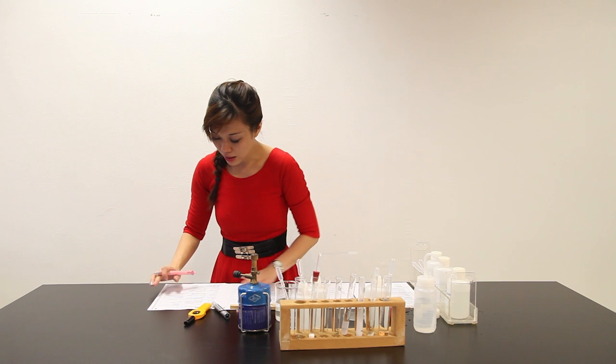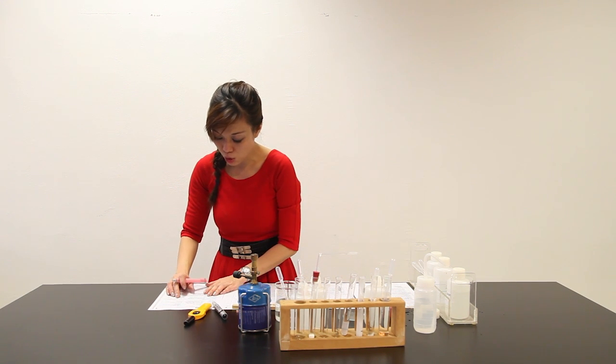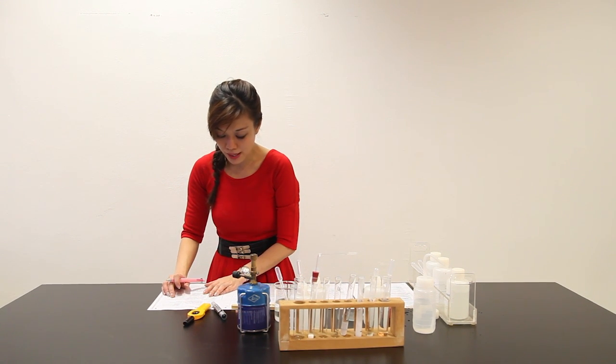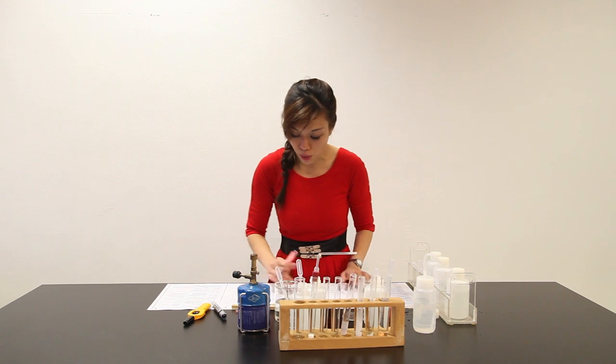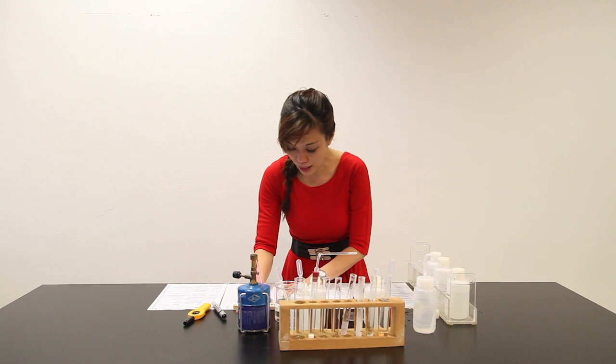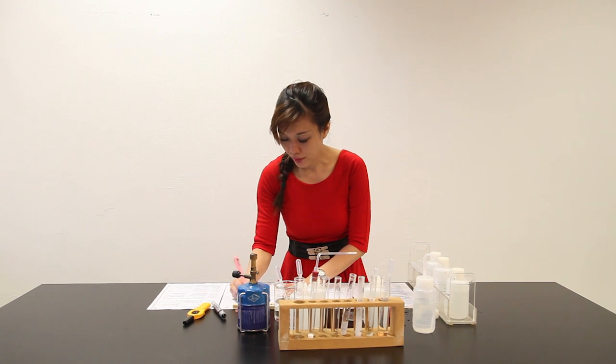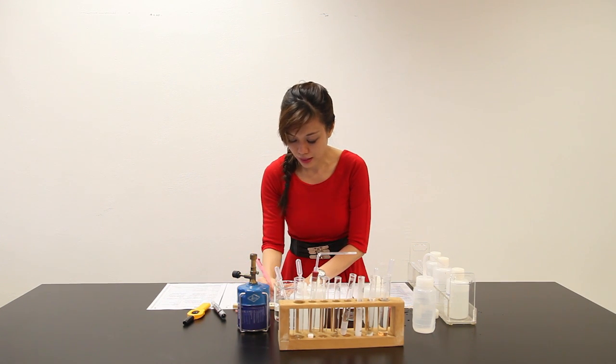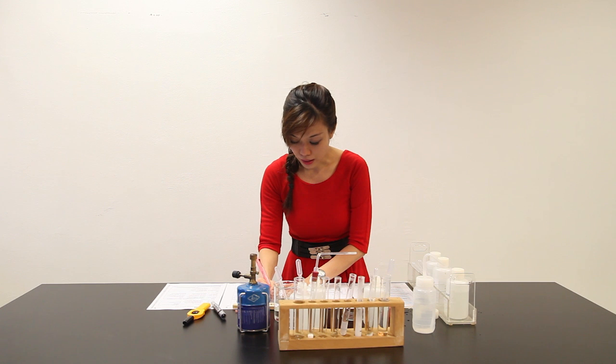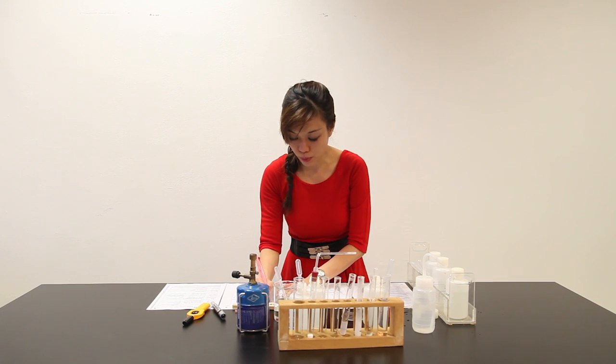Let's go back to the QA sheet here. The QA sheet says that if there is no PPT or slight PPT, calcium is present. So I can say that cation Ca²⁺ is present. Evidence part C: upon adding aqueous ammonia, slight white PPT was observed.